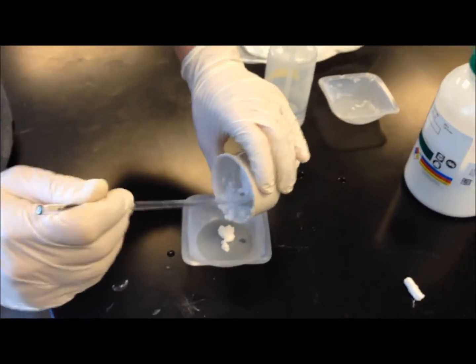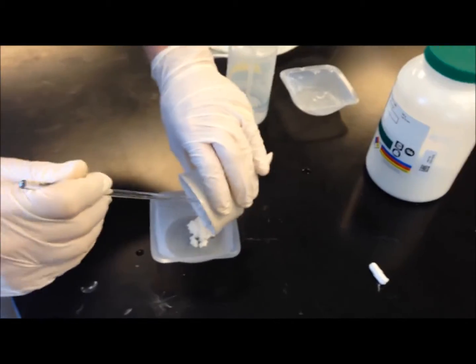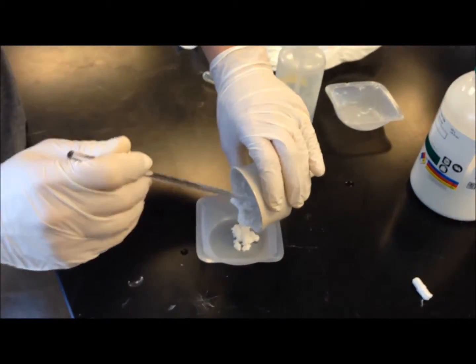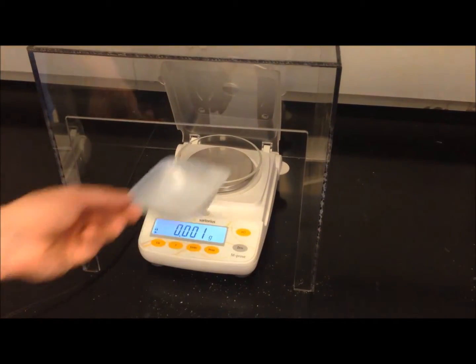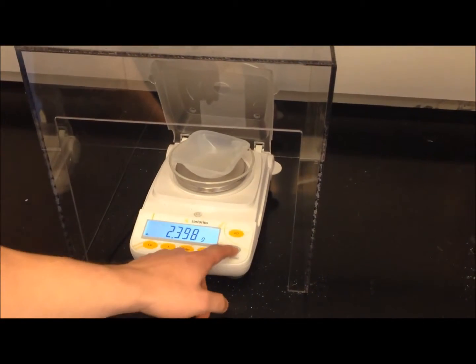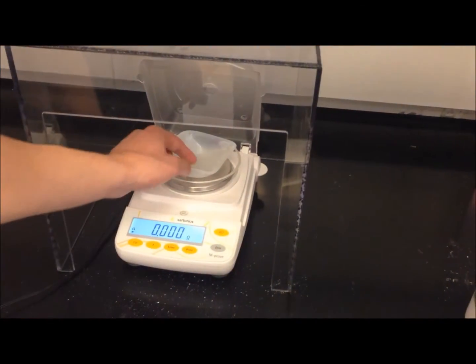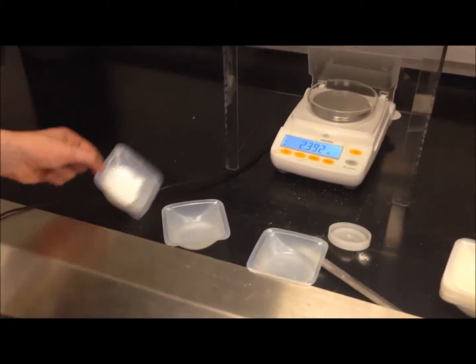After the washing and filtration step, we transferred our aspirin sample to a weigh boat so we could allow it to dry. After 24 hours, we massed our final sample, and it came up to about 1.2 grams, which is around a 50% yield based on our starting amount of salicylic acid.